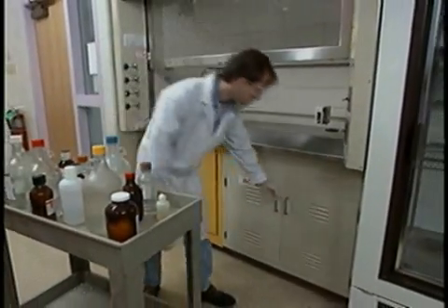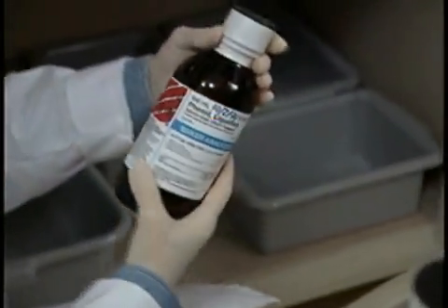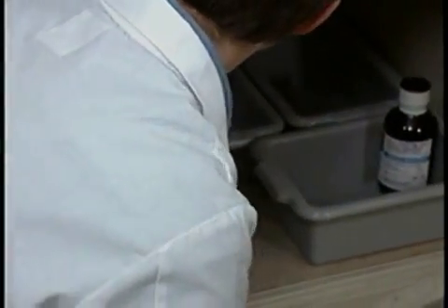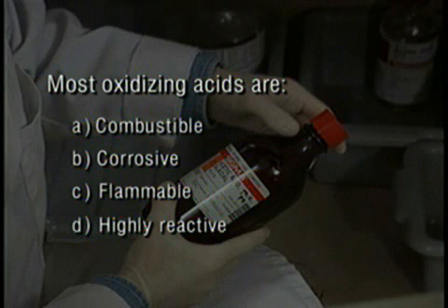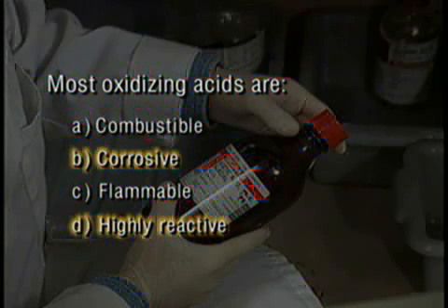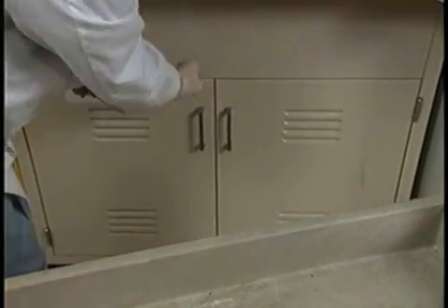Storing corrosive, toxic, flammable, and highly reactive chemicals near a fume hood encourages use of the hood when transferring chemicals. For storing acids, Mario uses trays that will catch any spill and at the same time provide adequate segregation. One recommendation, which Mario follows, calls for storing only mineral acids, including nitric acid, in the acids cabinet.